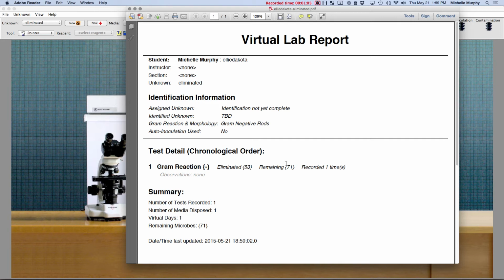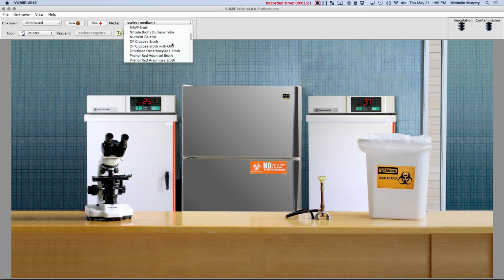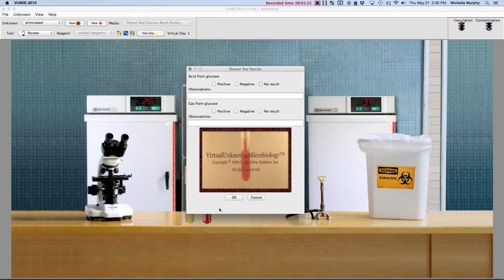Now it's going to take us a few labs to get to that point. We're not going to be able to do that right off the bat. We're just kind of going to be learning for the first few. So what we'll do next is a test. We're going to try to narrow that 71 down and figure out what that is. So we're just kind of going to guess. We're going to do the phenol red glucose test, call it glucose 1, and we're just going to guess here. I'm going to say this is a positive test. So I'm going to record my results and say it's positive.